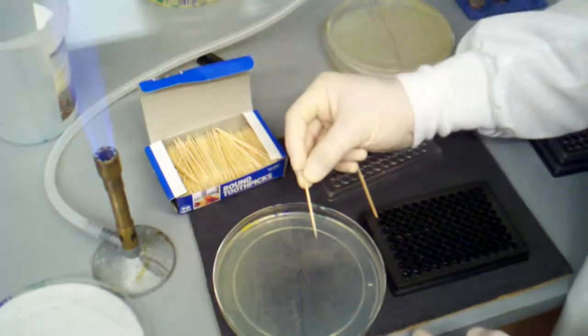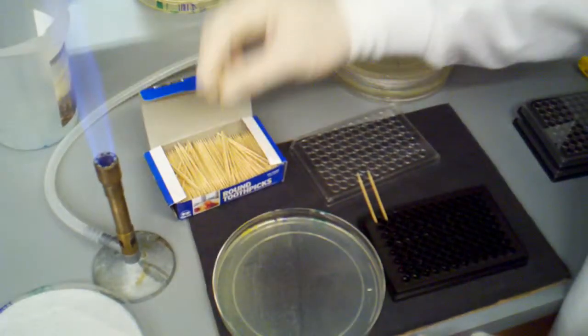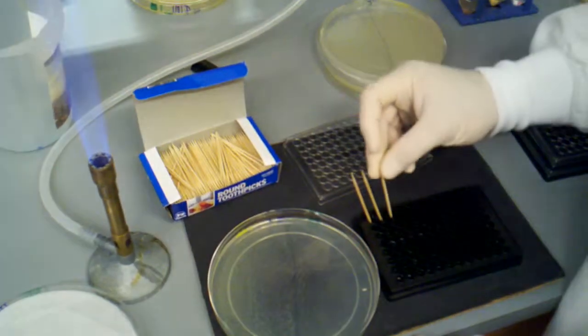So I've flamed it, pick a colony, go into the well. Get another toothpick, flame it, pick a colony, go into a well.